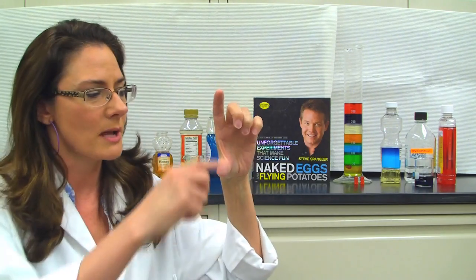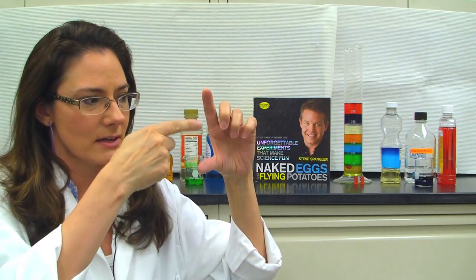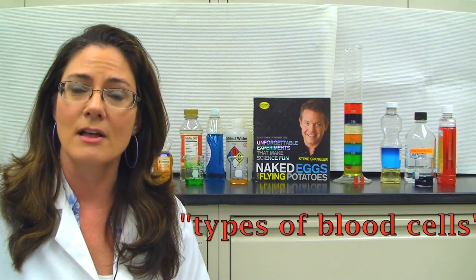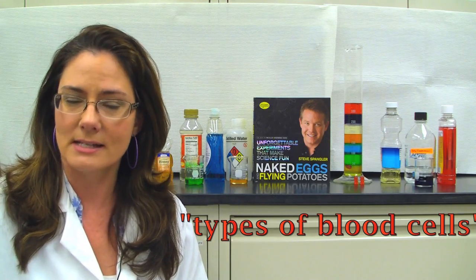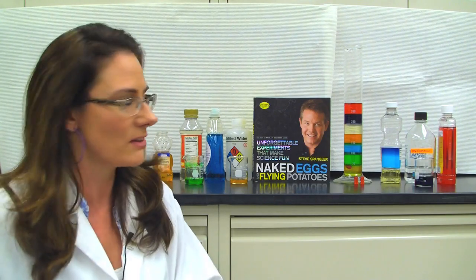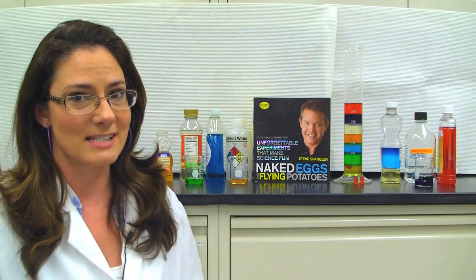So what we do is we take a test tube, and in the bottom we put a very heavy, dense liquid, and at the top is very light liquid, and then there's just different layers that's light, heavier, heavier, heaviest. And the organelles will fall and match that density. We can also do this if we wanted to separate out the 6 different types of blood cells, because each blood cell matches a different density. So these have been very useful diagnostic and research tools. Also, if we've just created a new material and we wanted to discover its density, there's a way to do that by creating a density column. Like I said, those columns aren't as colorful and fun as this one, but let's go ahead and take a look and see where my gummy bear falls in this density column.